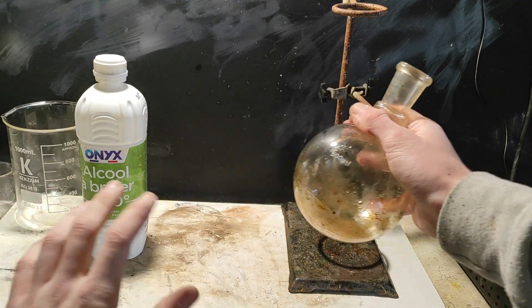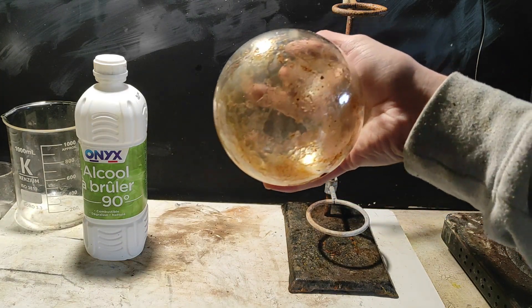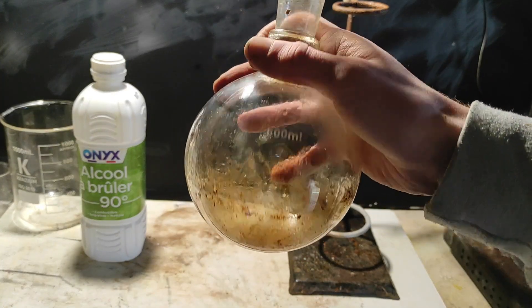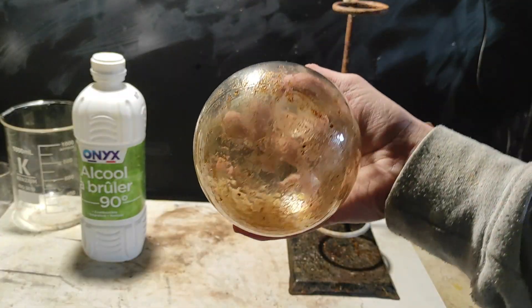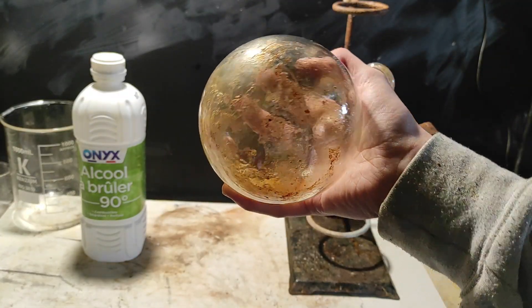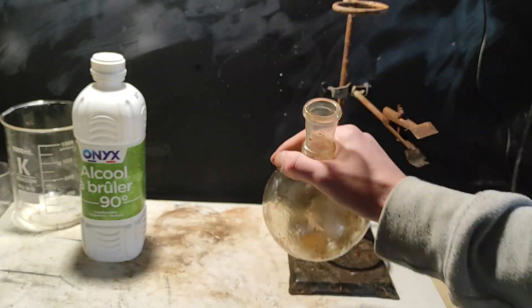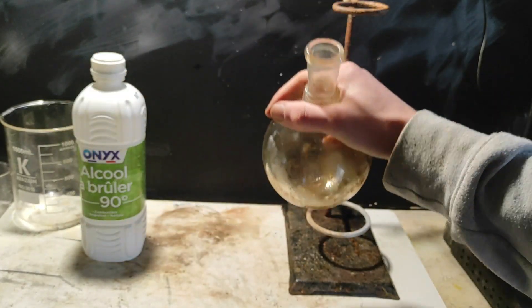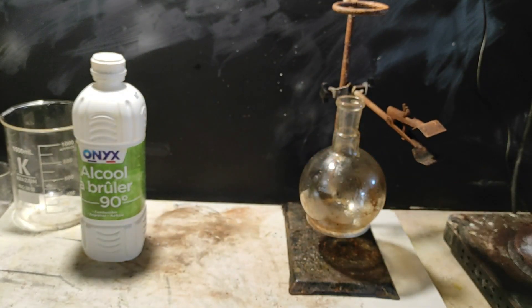Now that I have finished everything, I have disassembled the apparatus, now I just need to clean. This is the worst part, most of the time I don't show it, I think I've never showed cleaning. But, yeah anyway, so here we have some organic tar, you know, mostly I guess.